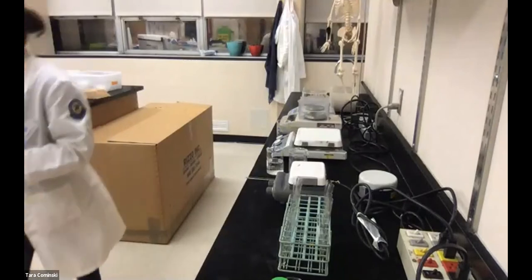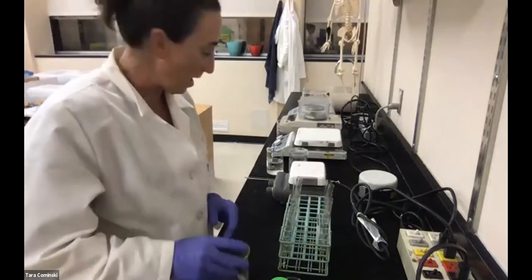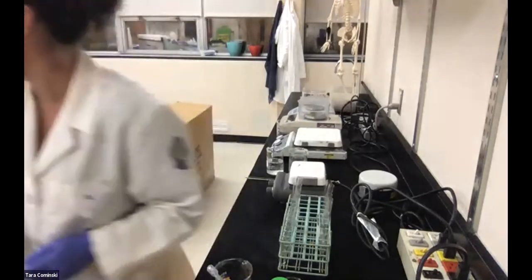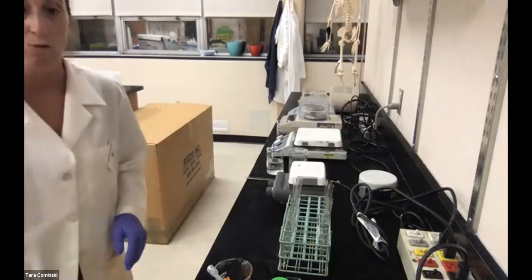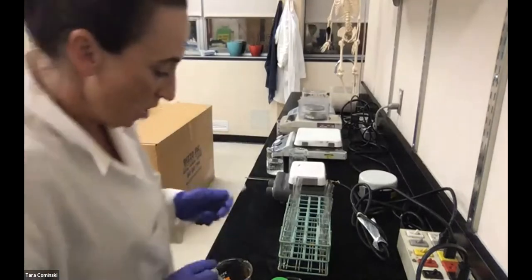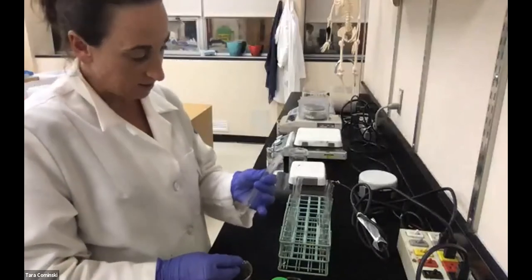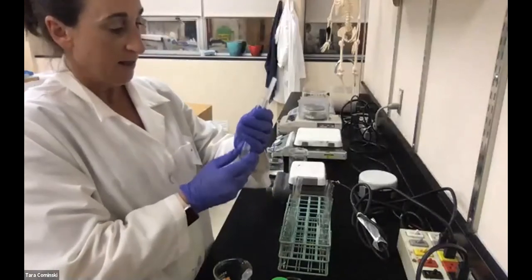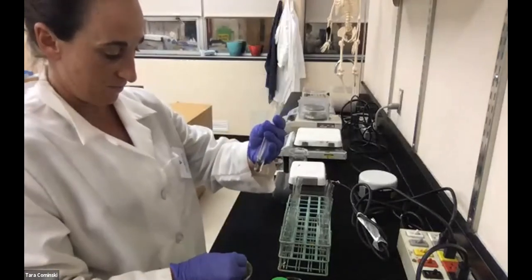And now we're going to add our hydrogen peroxide to each tube, and we're going to see what happens with the bubble column heights. Somehow I moved my ruler, oh, it's right here. Okay, so tube 1 is our pH 3. So let's add our hydrogen peroxide and see what that bubble height ends up being.